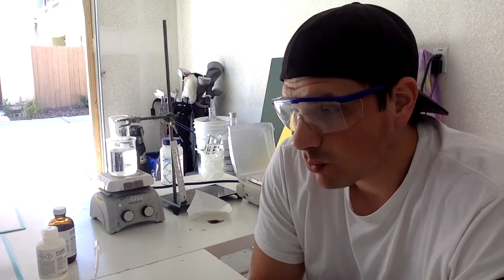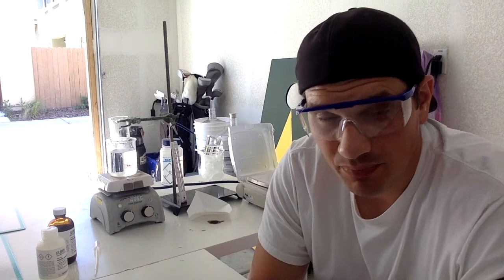We're going to do a synthesis of Aspirin Lab today. This is a really involved lab, kind of intro-level organic chemistry. It's super, super fun. I got my setup of chemicals over here. I'm going to do it in a couple parts, though. This first part, we're going to try to ester. We're going to try to knock off that phenol group on the salicylic acid and add that ester group. It's called an esterification, okay?